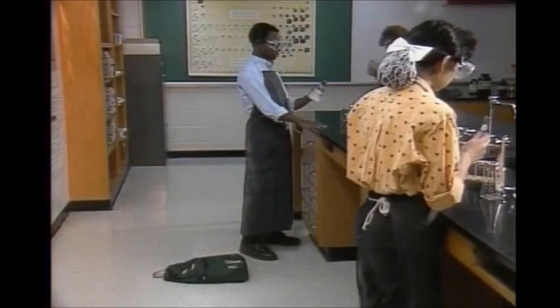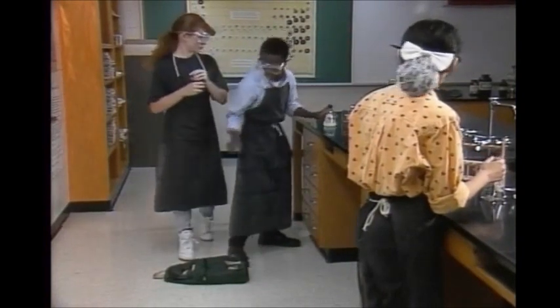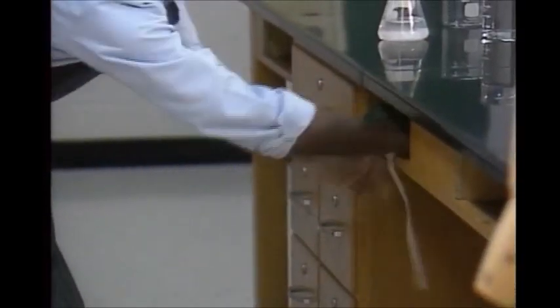Even if you're not fooling around, accidents can happen. Wait a second. Personal belongings in the middle of aisles can trip someone.